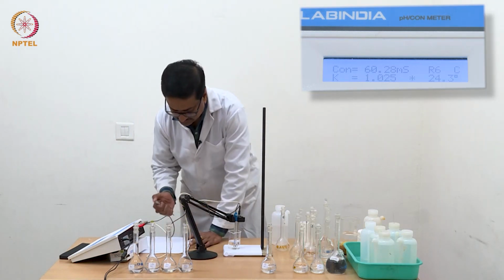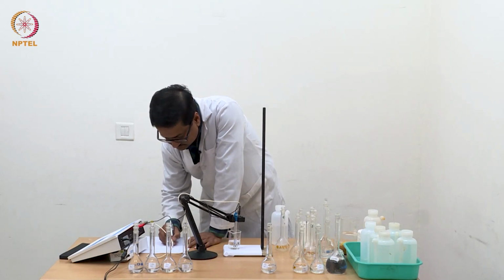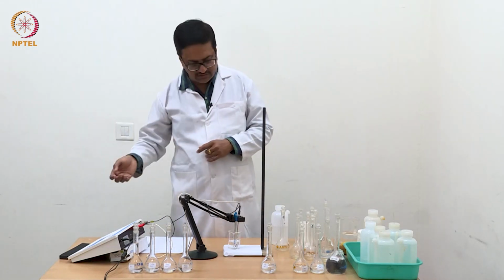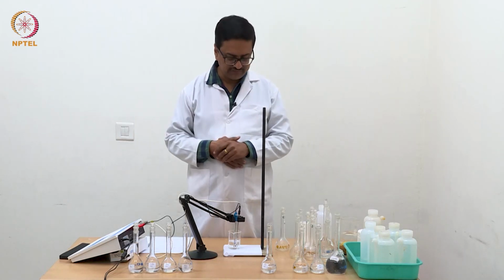So we are getting 60.29. So we will try and see whether it can read more than 100. So we will try the next solution as well.